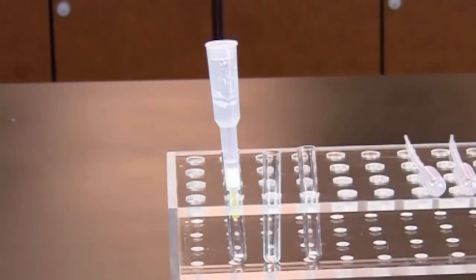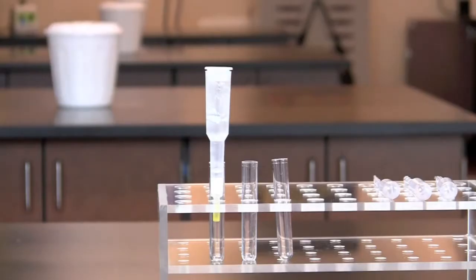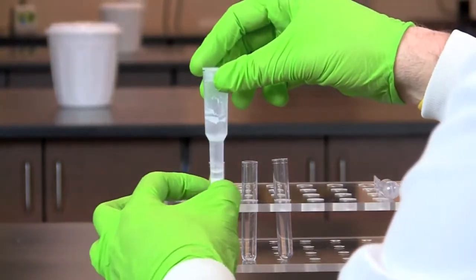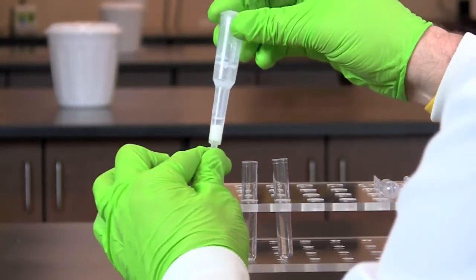Label three collection tubes 1, 2, and 3, and place them on a rack with the column. To prepare the column for use, remove the caps from the top and bottom of the column.